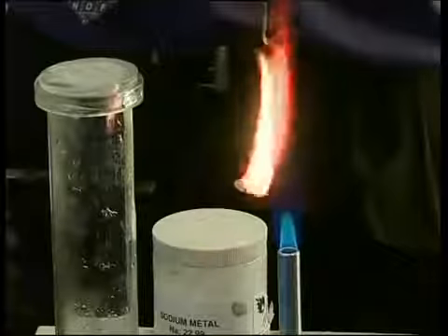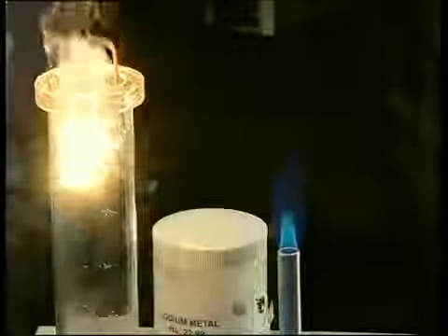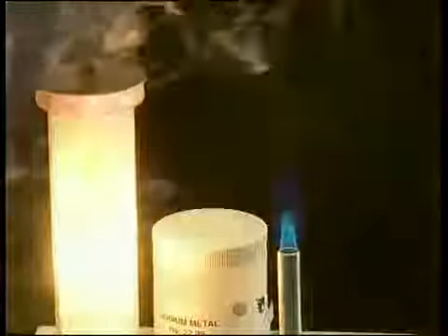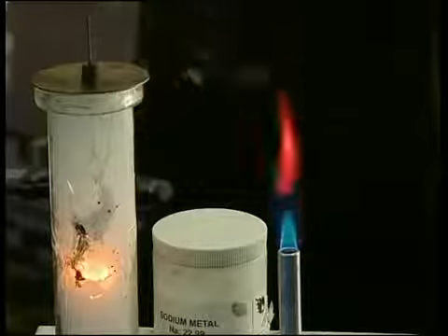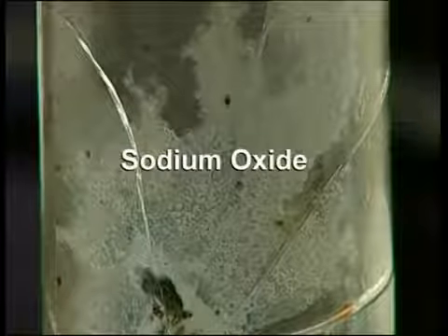As the sodium starts to burn, you should be able to observe that it burns with a yellow-orange flame. As expected, it burns more vigorously and more brightly in oxygen. A white product called sodium oxide is formed.